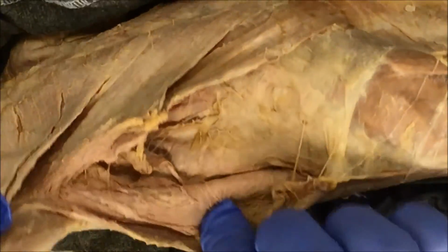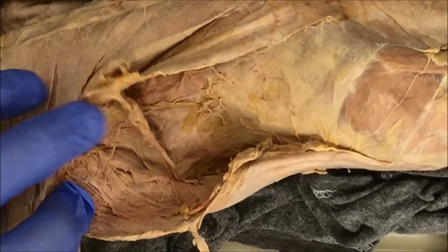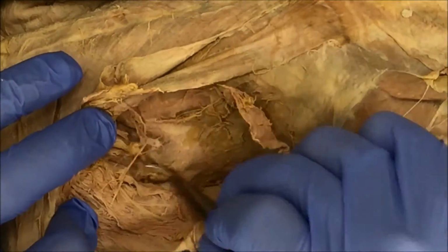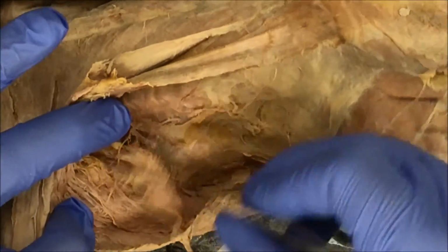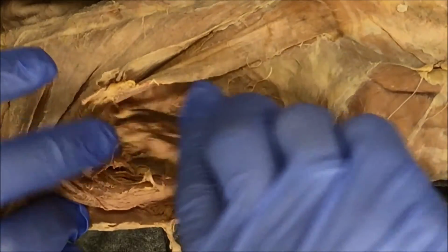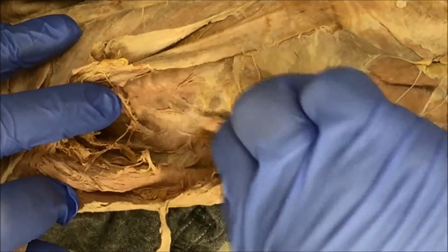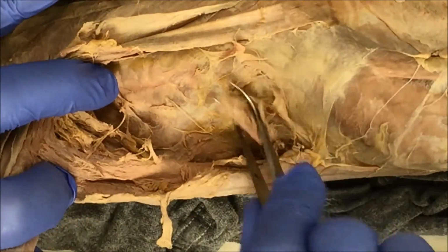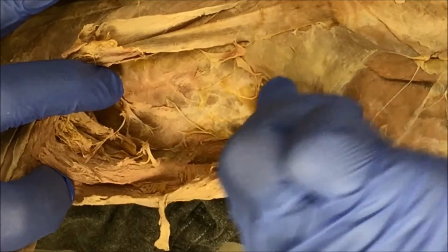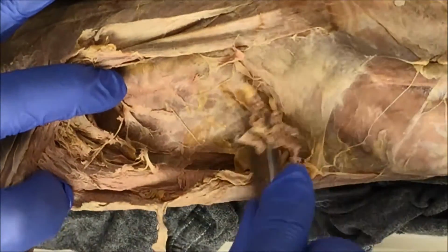The next muscle that I have to get to is right here. It's called the serratus ventralis. You can see there's a lot of connective tissue and a lot of fat. We're going to get rid of this until you can see it. The serratus ventralis kind of looks like a little fan. I'll do the best I can trying to hold the cat in this position while dissecting. It might be a little challenging or tricky, but I'll try it. By removing the connective tissue, hopefully you can start to see the serratus ventralis.